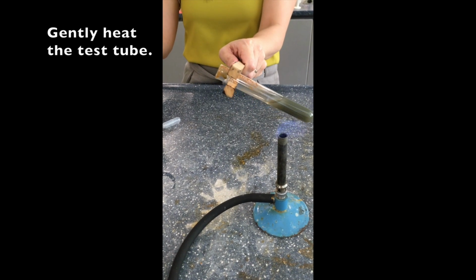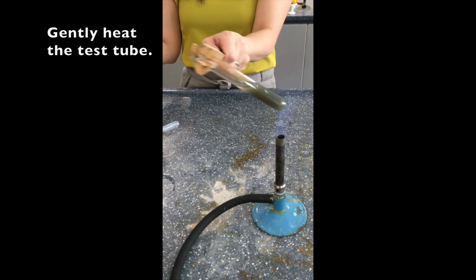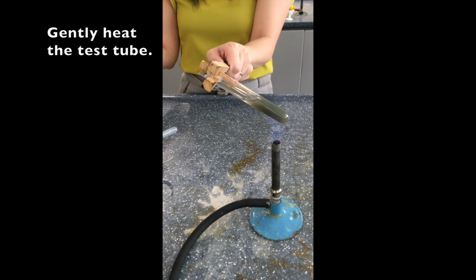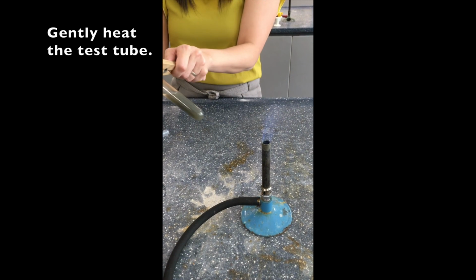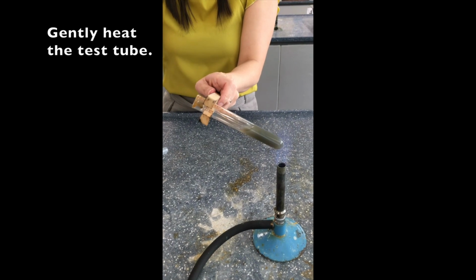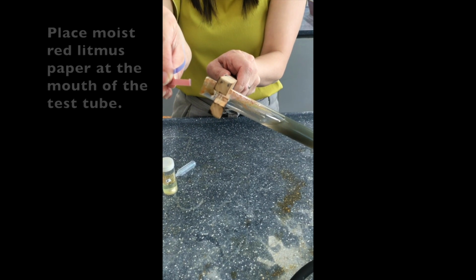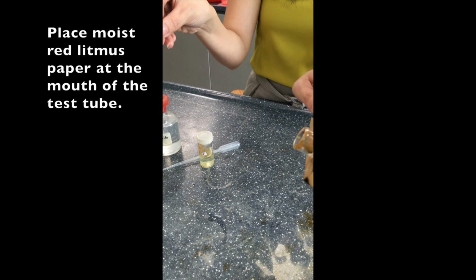And once you start to heat, heat for at least 1 minute, even up to 2 to 3 minutes. You get ready your moist litmus paper, and place it at the mouth of the test tube. So you can see that we're letting the gas touch the moist litmus paper as the gas comes out of the test tube.